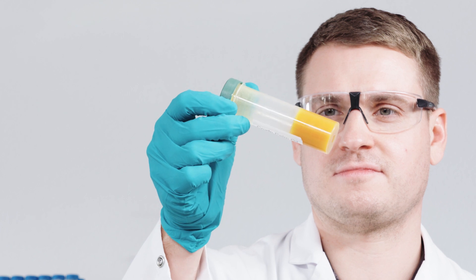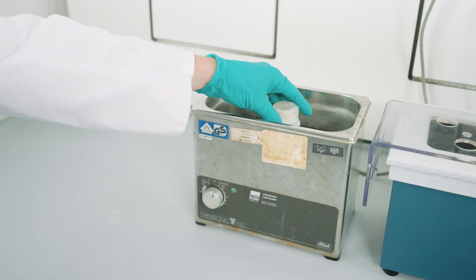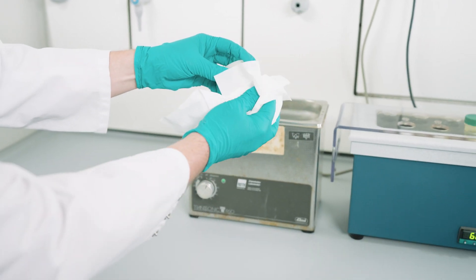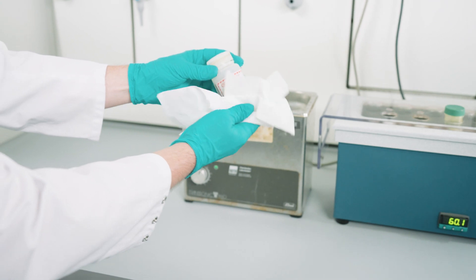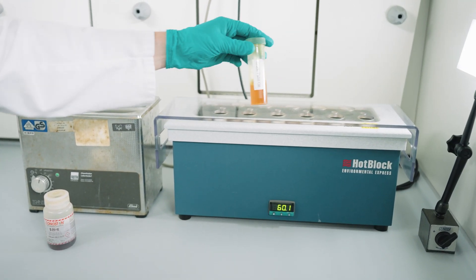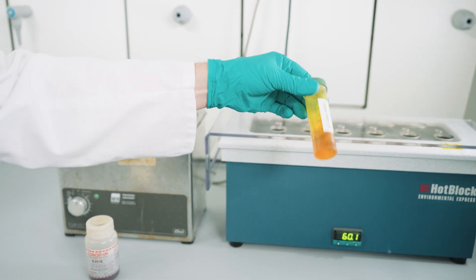Let's have a look at the sample and standards preparation procedure. Here you can see that the samples are partially crystalline and highly viscous. This is why the samples have to be liquified and homogenized before use. We use an ultrasonic bath with appropriate heating to about 60 to 70 degrees Celsius for this task. The use of a hot block and an intense shaking of the warm solutions will lead to the same result.